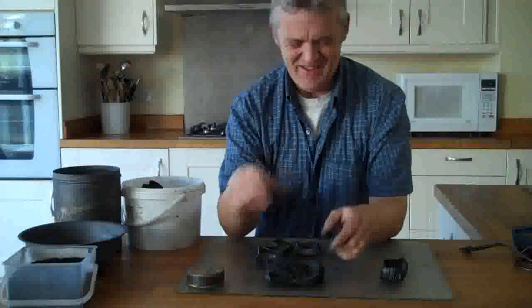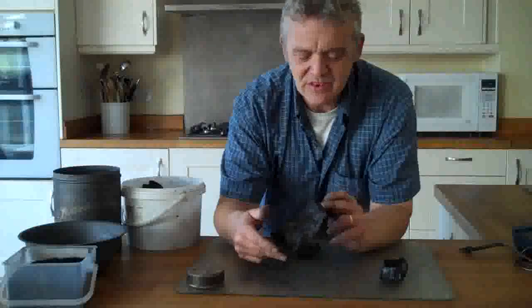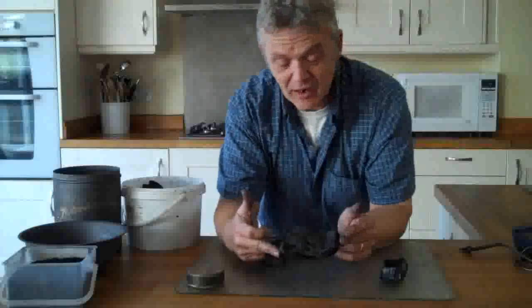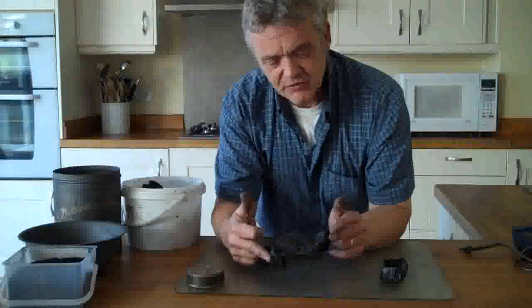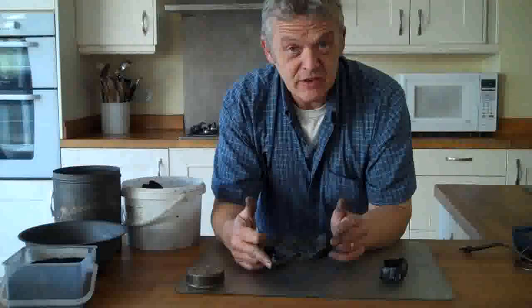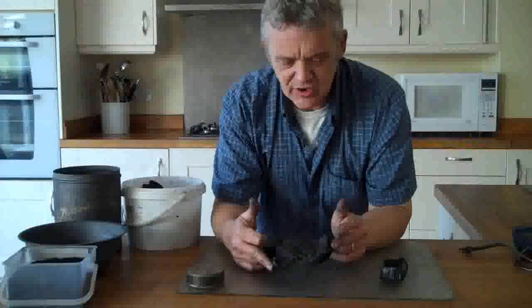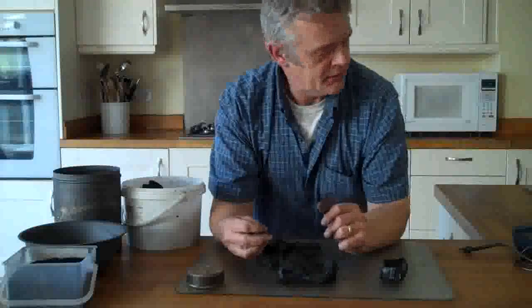Here is the toilet paper that we gave a go, and we've got a similar result. The stack of toilet paper has clearly glued itself together so it's going to be impossible to get those apart. There's been a fair degree of warpage because I just stuck them in and prodded them down. To get a flat piece you'd have to use a sheet of steel or something like that and rest it out flat to prevent this curling. But it's carbonized really really well and it looks quite graphitic.